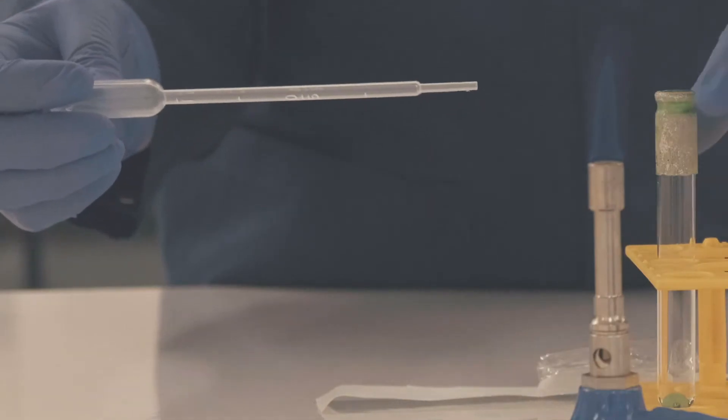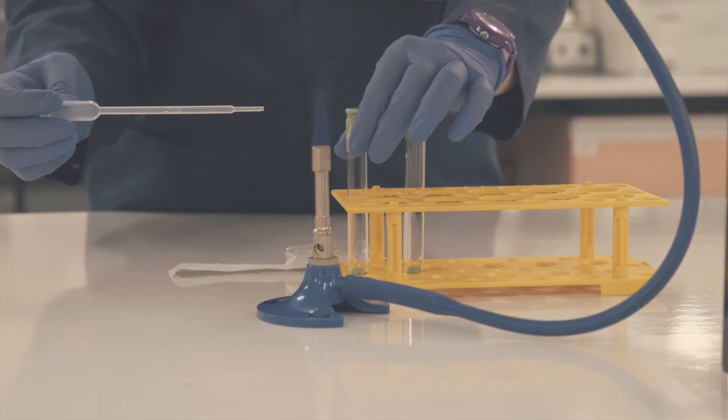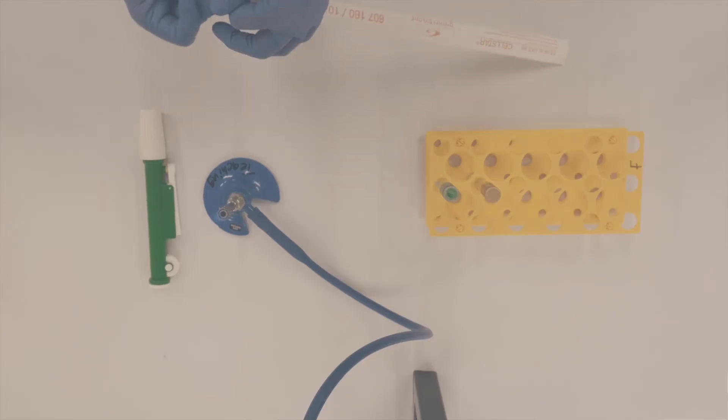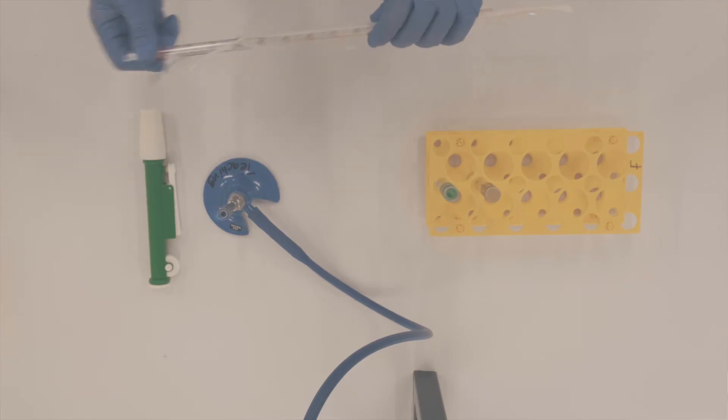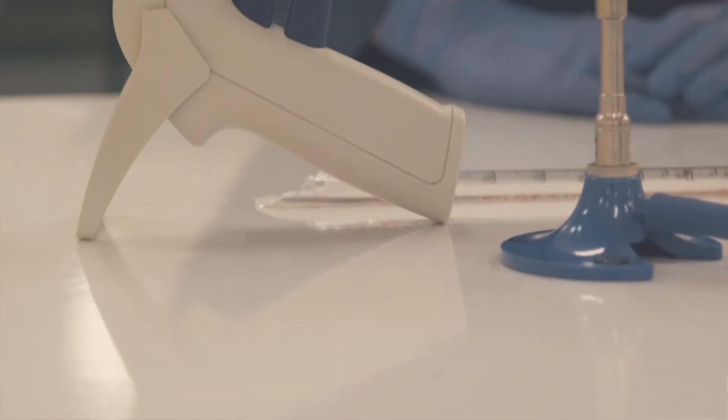Next, let's look at how we transfer liquids using aseptic technique. Liquids can be sterilized in bottles or tubes, so anything that touches the liquid needs to be pre-sterilized. Pipette tips, Pasteur pipettes, and graduated pipettes are all common examples. Pre-sterilized items do not stay sterile for long — as soon as they make contact with airflow, non-sterile bench surfaces, or your gloved hands, they become a potential source of contamination. For single-use Pasteur and graduated pipettes, remove them from their wrapping and avoid contact between the end of the pipette that will touch the liquid and any other surfaces. Graduated pipettes are used for larger volumes over one milliliter, with volume measurements labelled on the side. Both manual and electronic pipettes can be used.